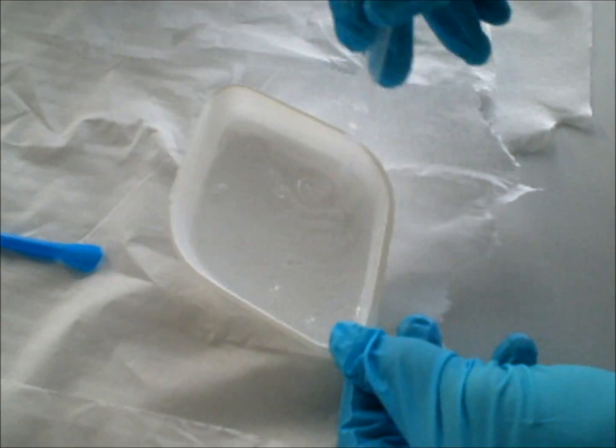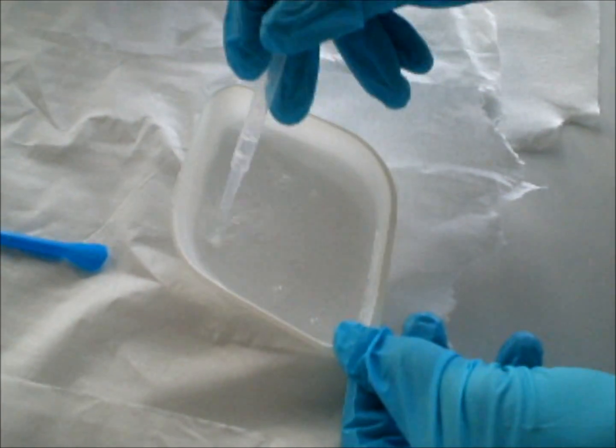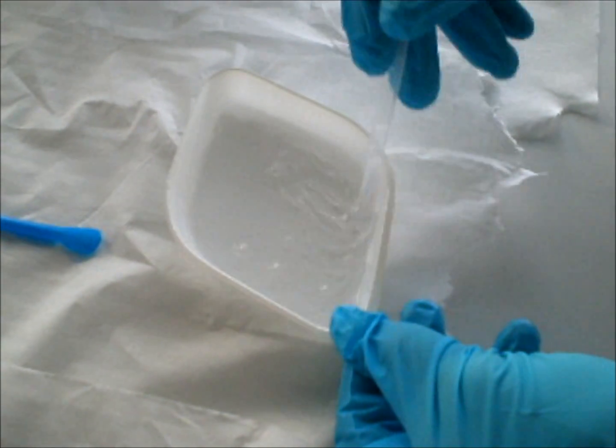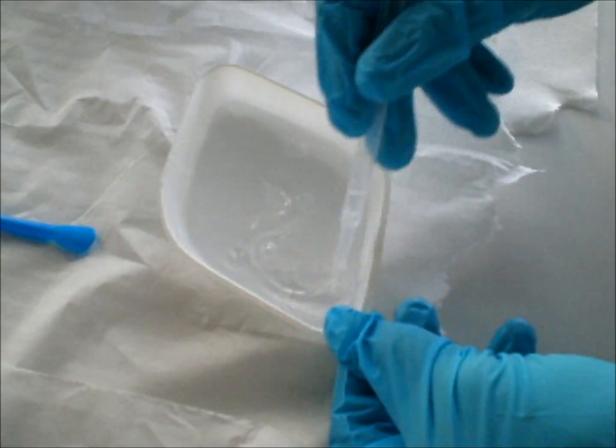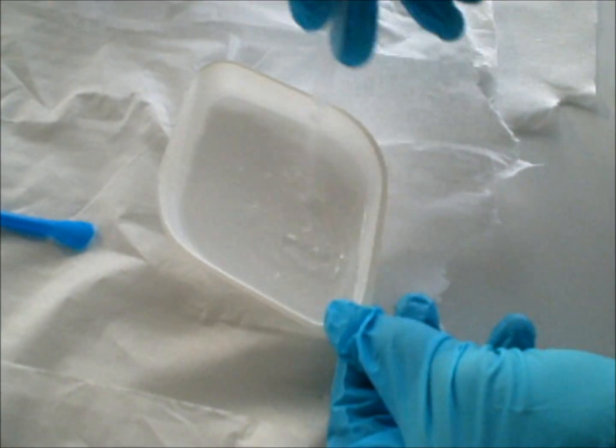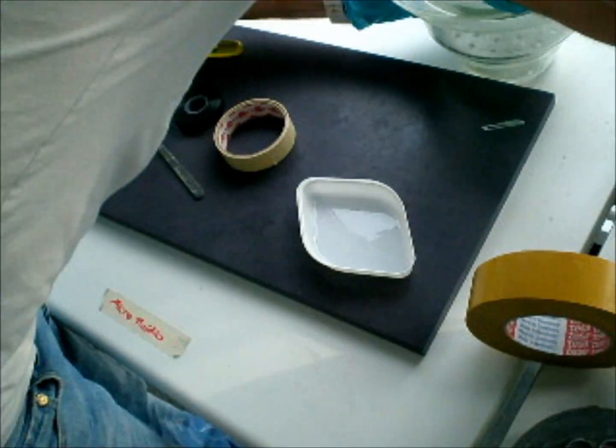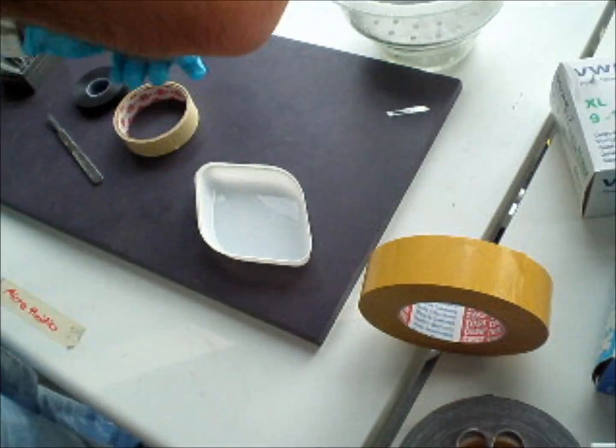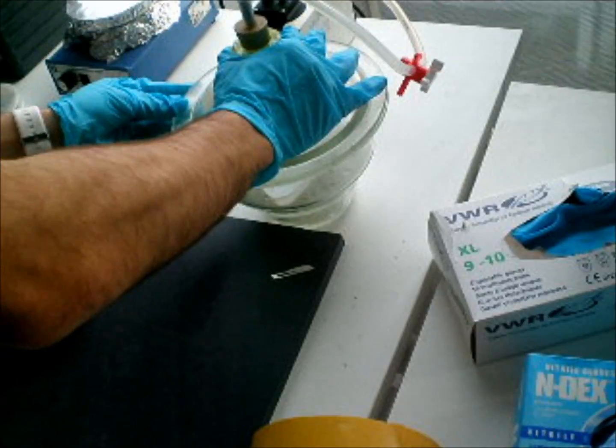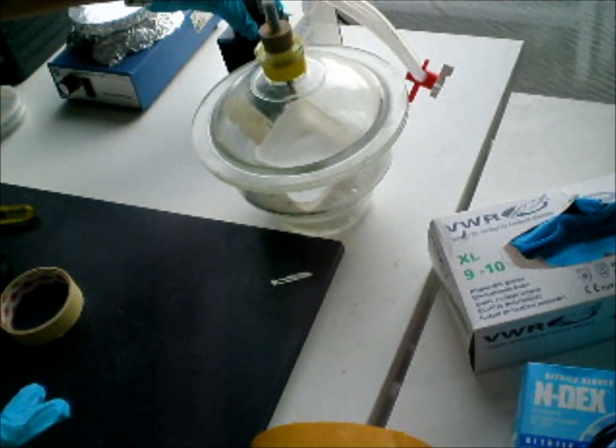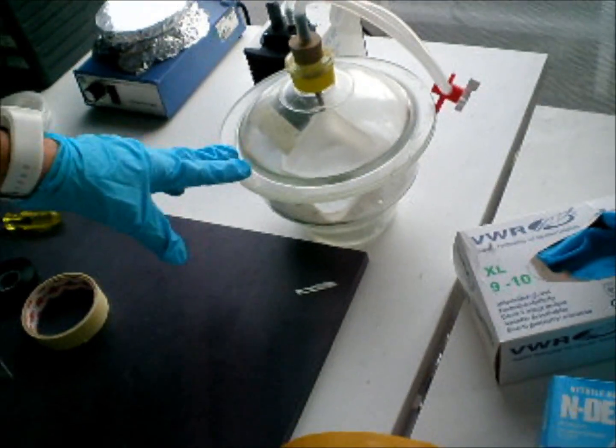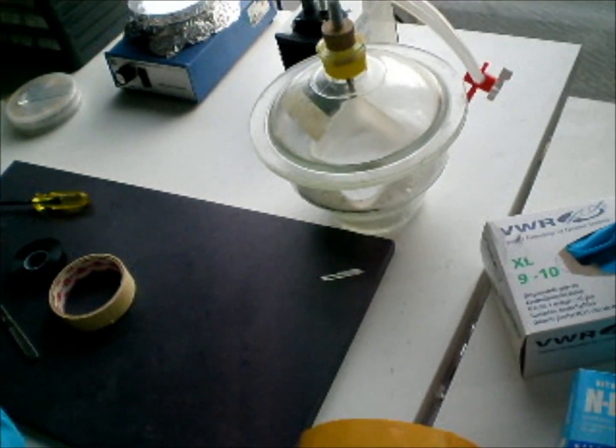So, the hardener will go everywhere on the silicone. It's turned on, so we will keep it here for half an hour and it's ready. I'll see you. Thank you.